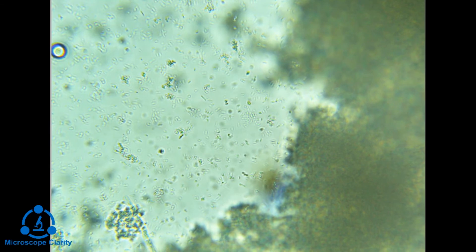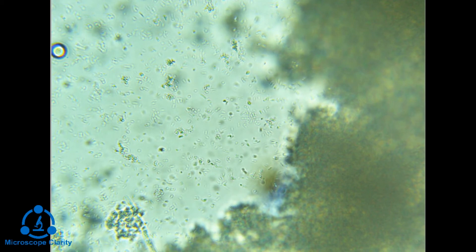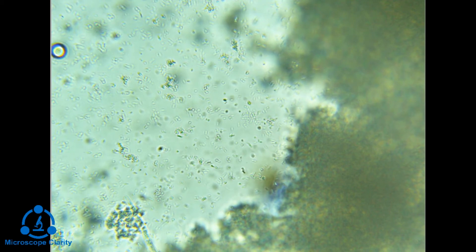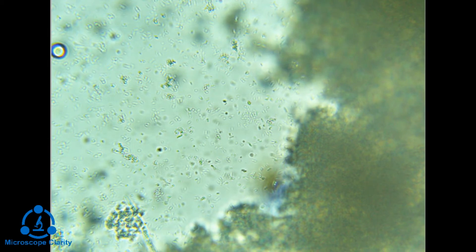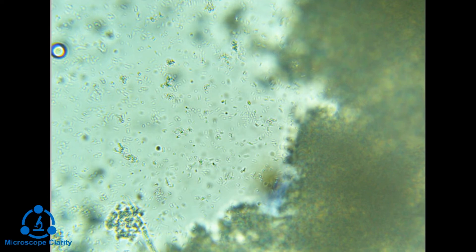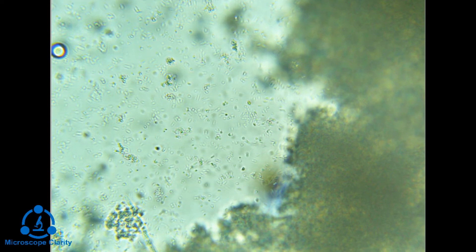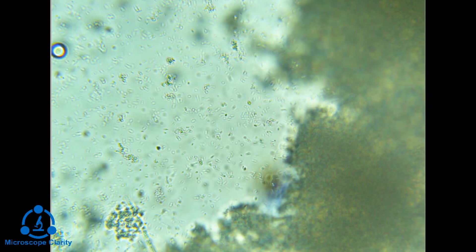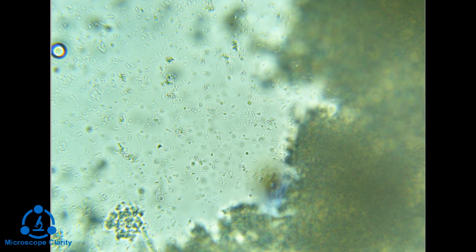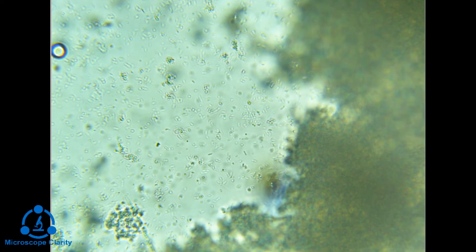There are better ways to see bacteria. You could stain the bacteria, or phase contrast is probably the most popular method. Phase contrast will give you some contrast to be able to see the detail with the bacteria. But I think for what we're going to do, this is going to be enough detail for us. You can see there's a lot of movement here, a lot of bacteria in this leftover smoothie.